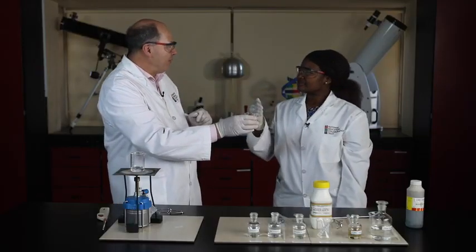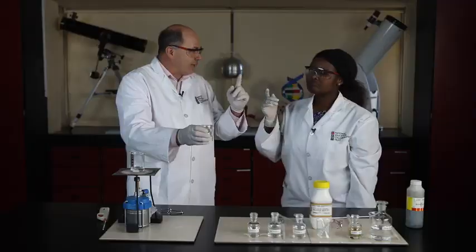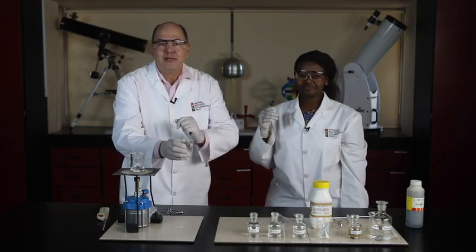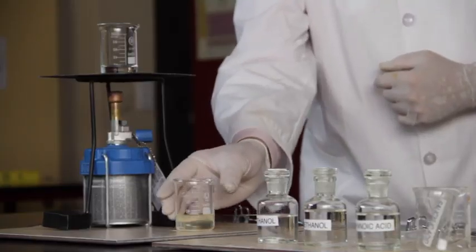You know what it reminds me of? Athletes' change room. Oh, it's the one that we used to treat sore muscles, as well as sprained ankles. That's right. It's called wintergreen. This is a very pleasant odor. Learners, record the fragrance of this ester formed by the reaction of methanol and salicylic acid.